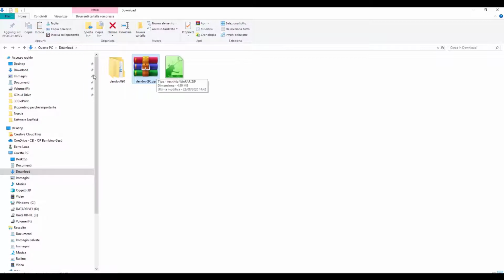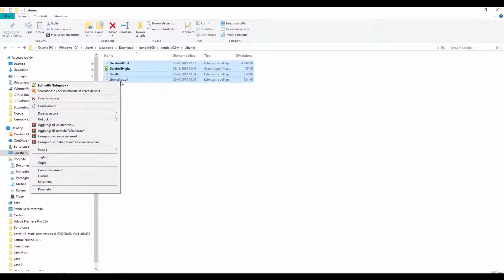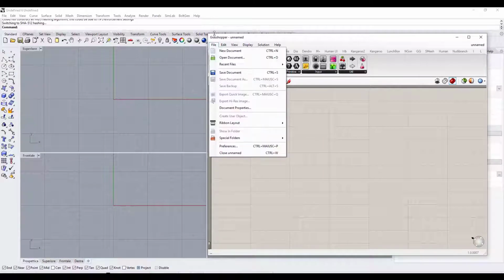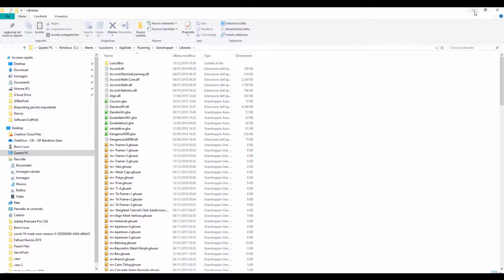We need to copy the files into the Grasshopper component directory. So we go to the Dendro folder, click on Libraries, select all files, right-click on them and select Copy. In Grasshopper, we click on File, Special Folder, Component Folder, and paste them into the folder. Now we are really ready to start drawing our 3D scaffold with Rhinoceros and Grasshopper.